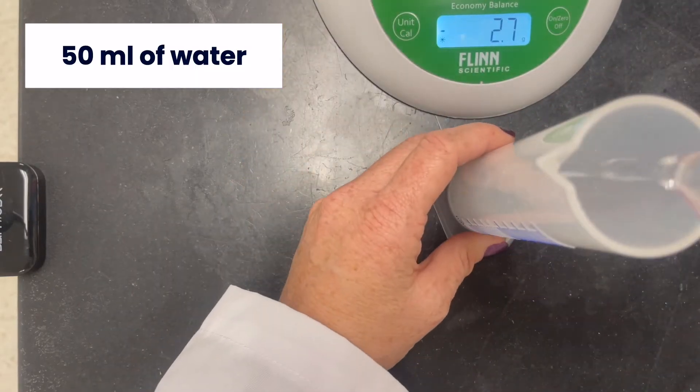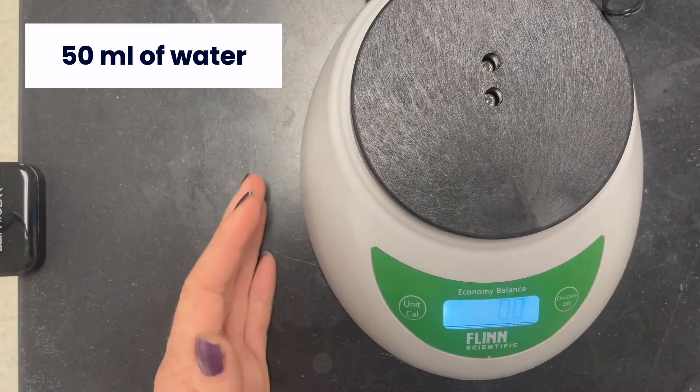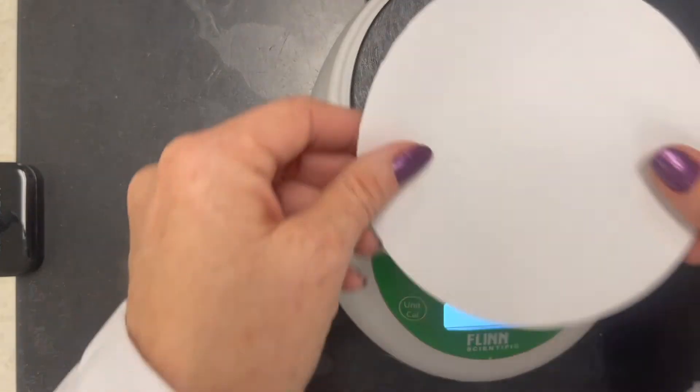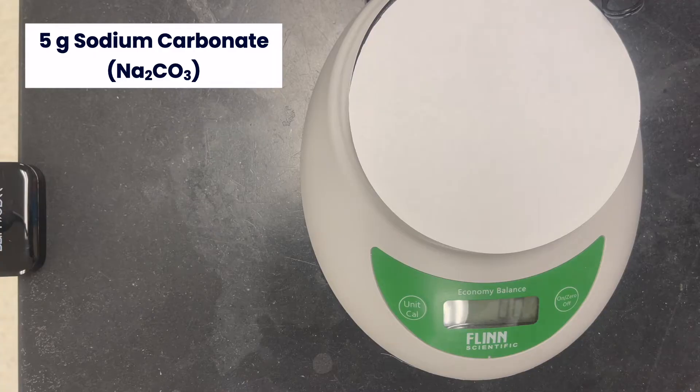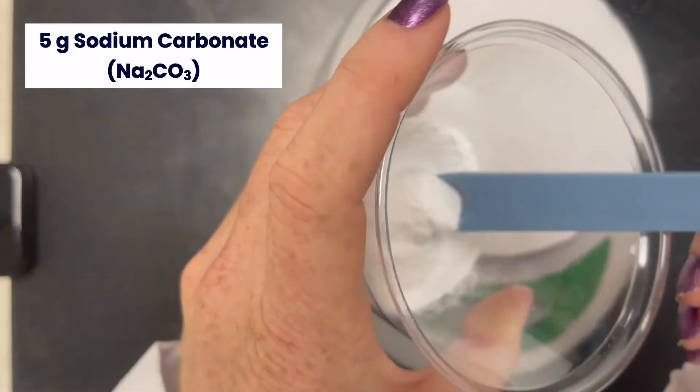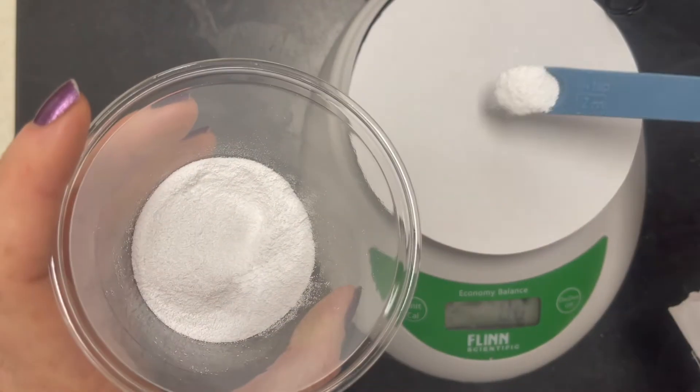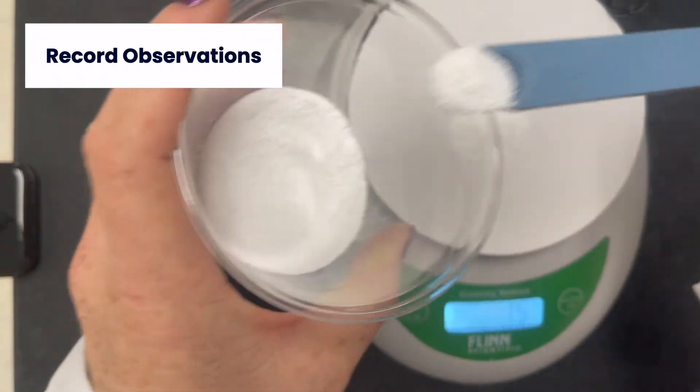Now, take 50 ml of water and add 5 grams of Sodium Carbonate. What does Sodium Carbonate look like?